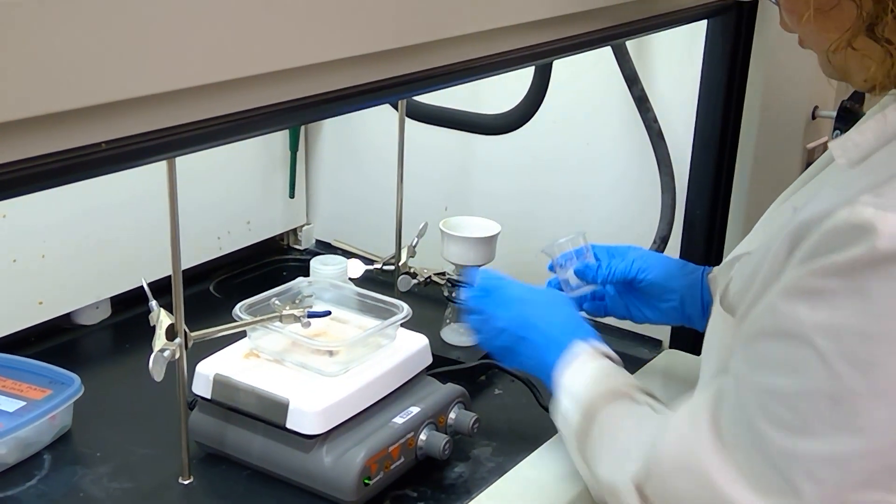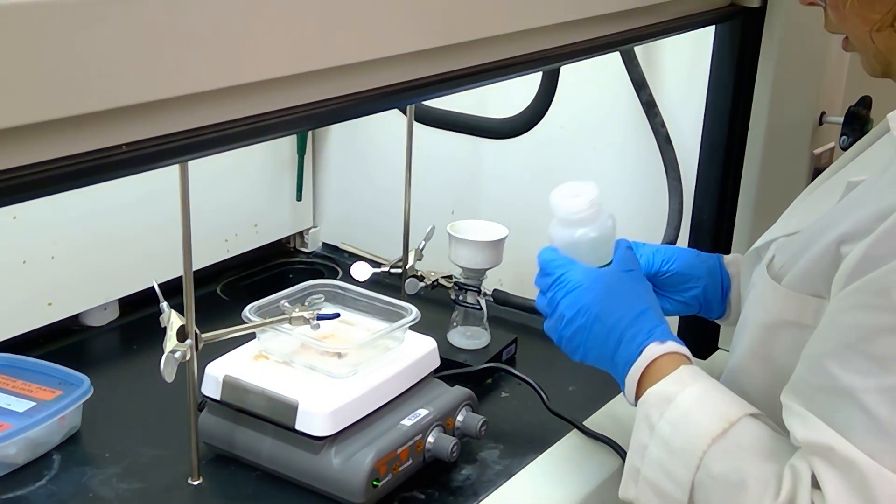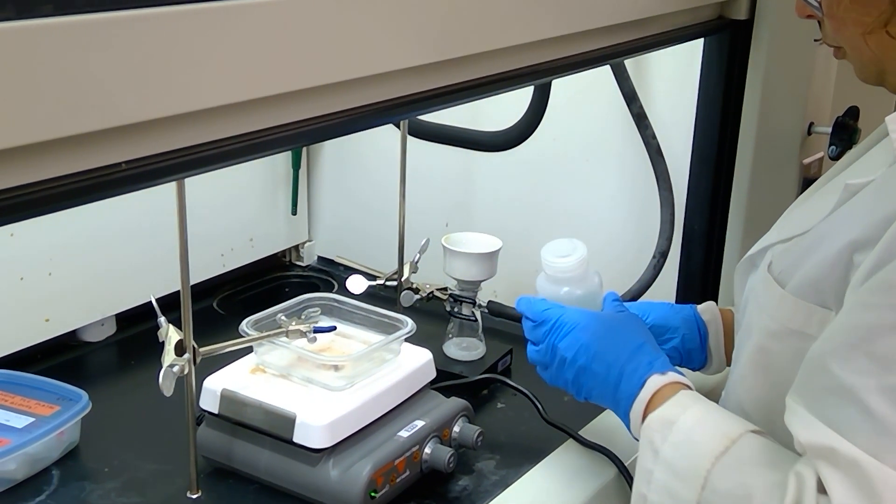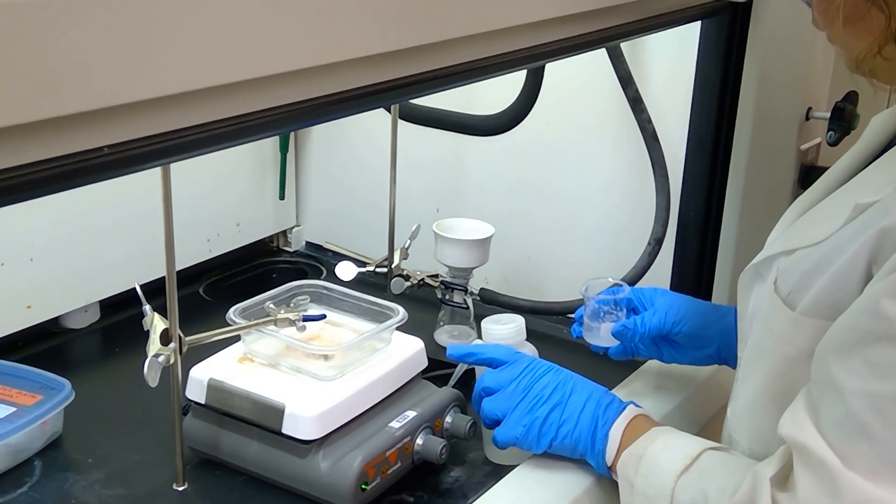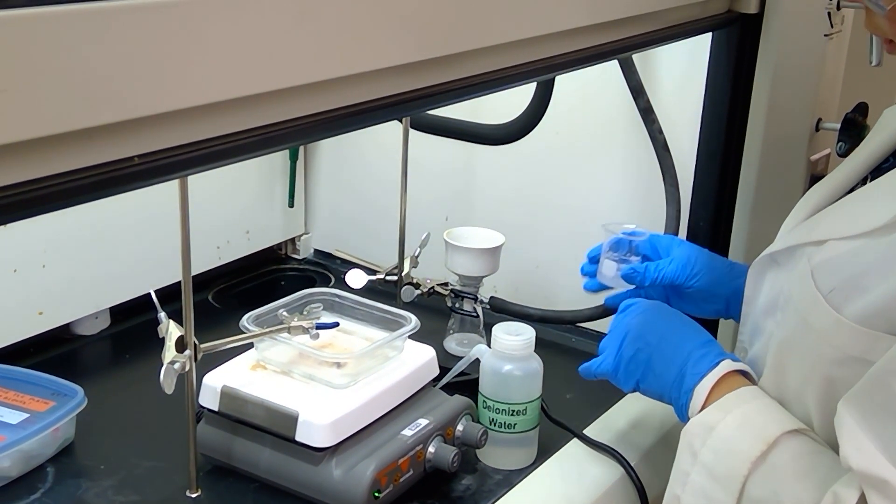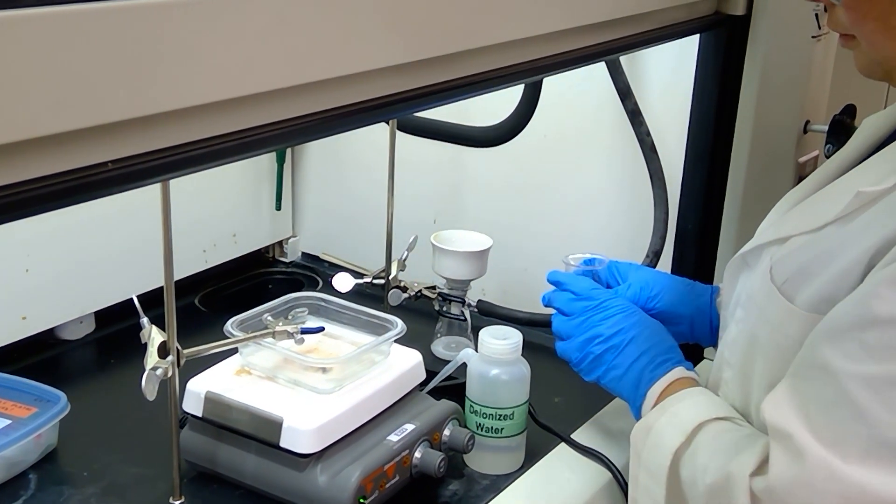I'm going to go ahead and give our solution a little rinse down. A little more water. And once this finishes filtering, we'll be able to isolate the solid and weigh out our mass.